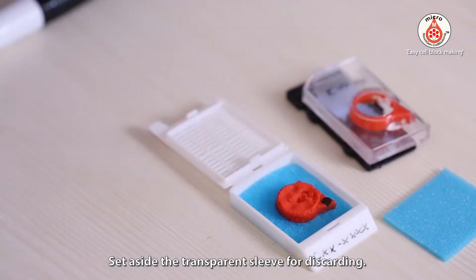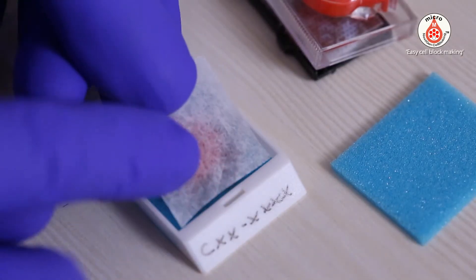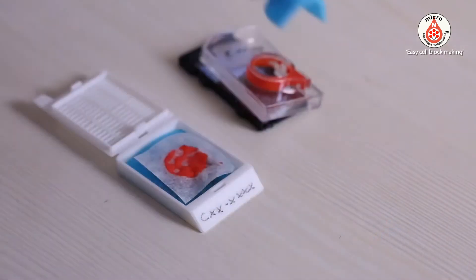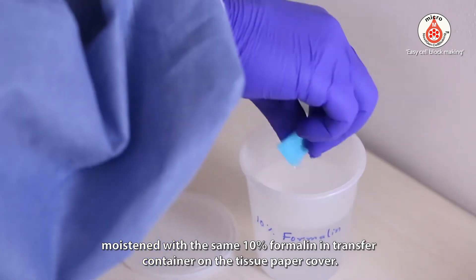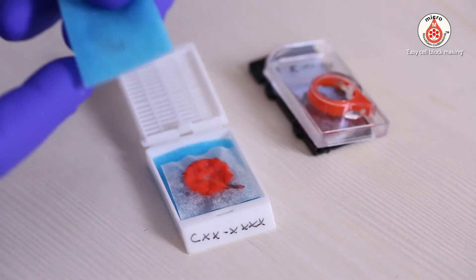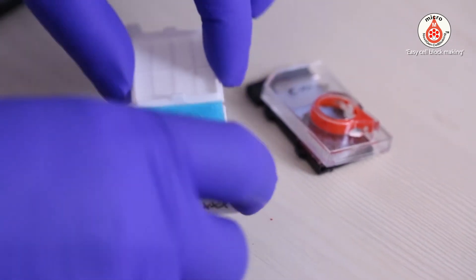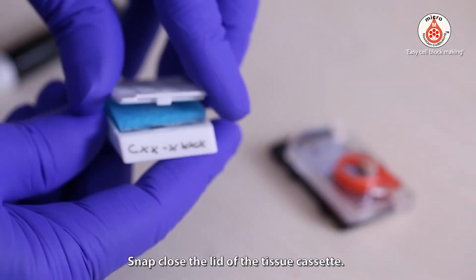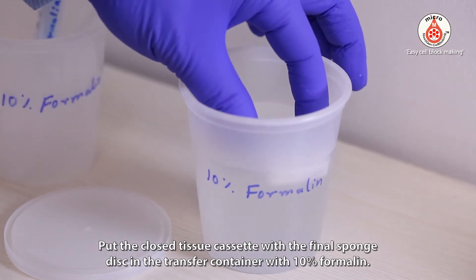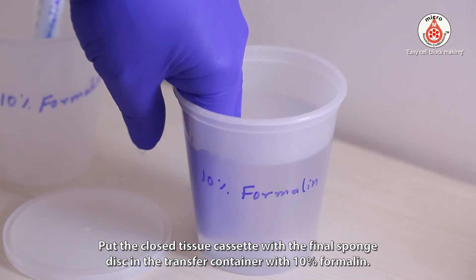Set aside the transparent sleeve for discarding. Put a tissue paper cover on the sponge disc. Place the second tissue sponge, moistened with the same 10% formalin from the transfer container, on the tissue paper cover. Snap and close the lid of the tissue cassette.